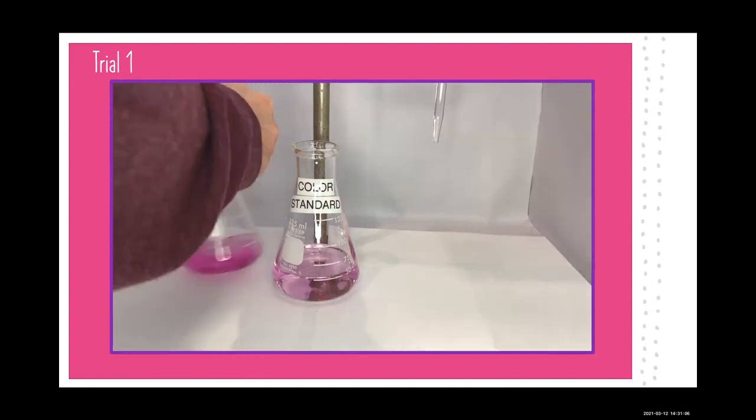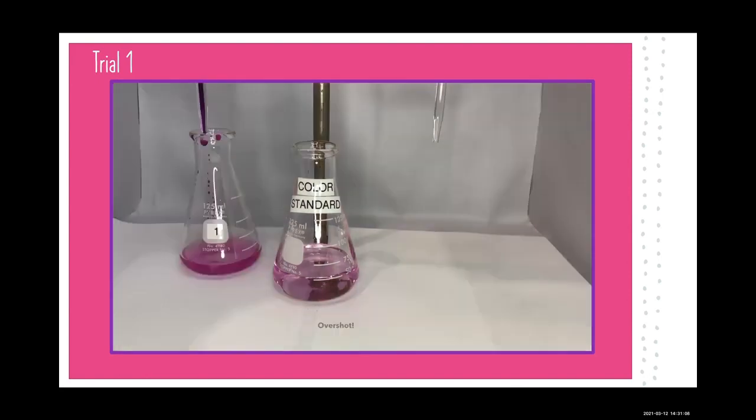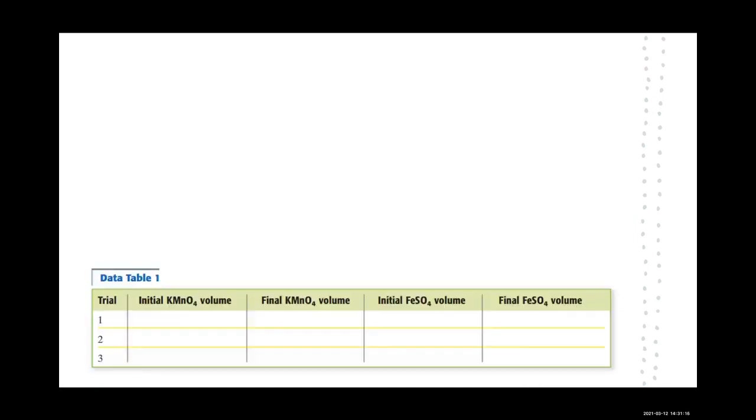And as you can see, we actually overshot it a little bit. It's a little too intense, the color. It should be lighter than that. But we're going to record our data anyway.